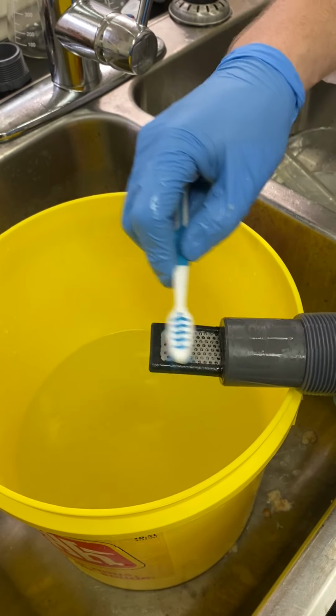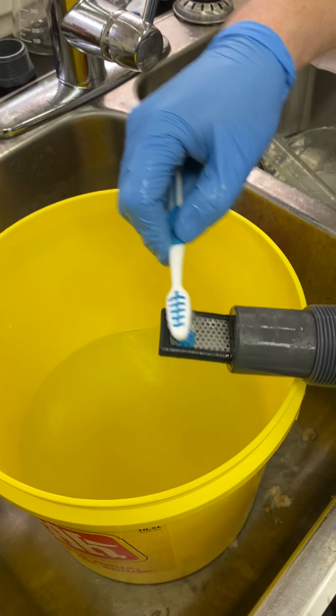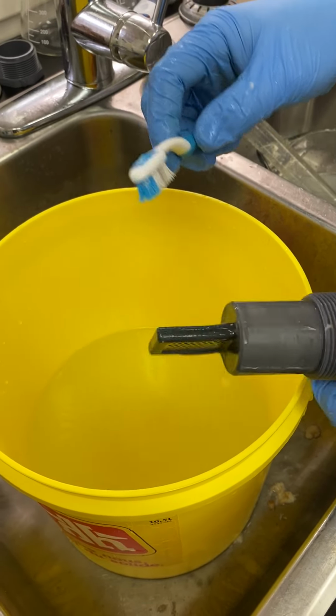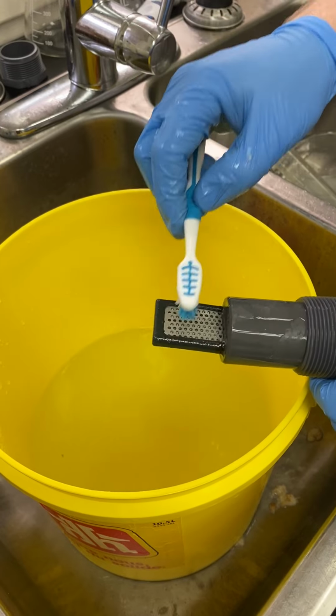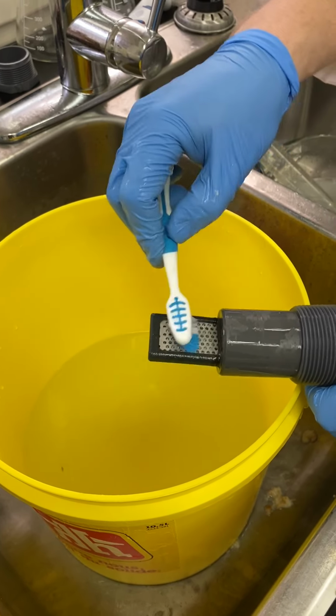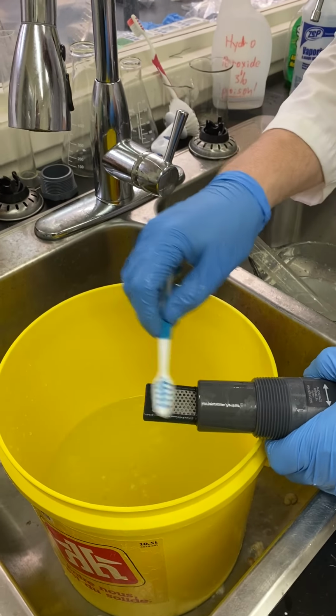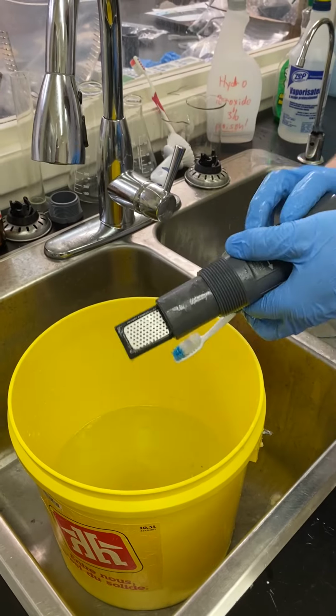Just with tap water, process the cleaning from between the electrodes. Don't touch the carbon mesh, just the metal side of the electrode, like that. Rinse that again.